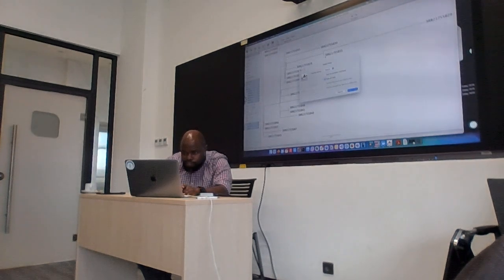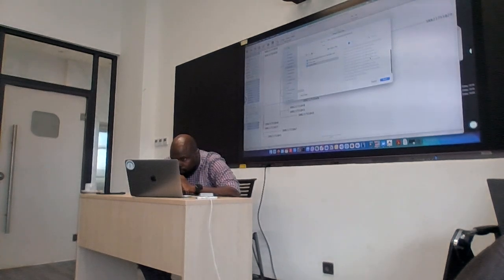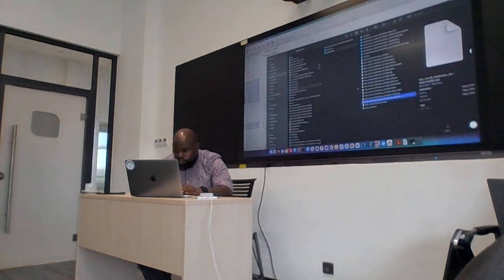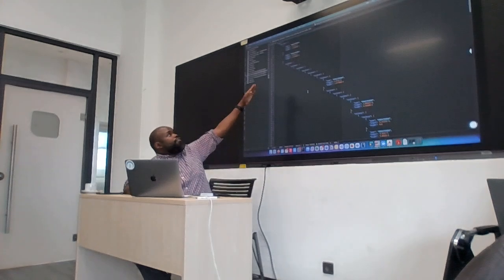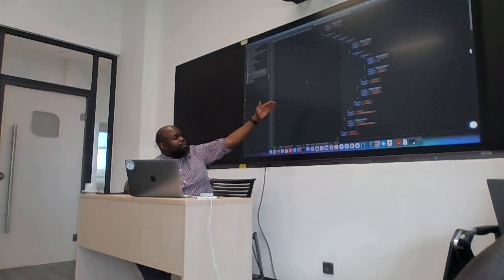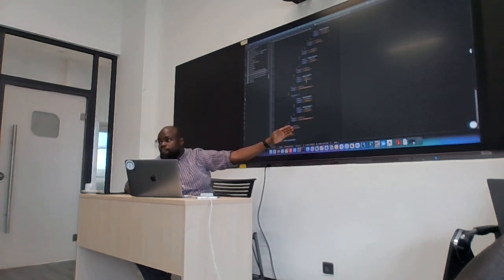Let's try and export it as JSON. Okay, I'm going to include annotations here. So the extension is going to be JSON. So I'll just try to open that. And you can see how the structure is. Okay? So you see that it's quite different from the Nexus and also the Newick.